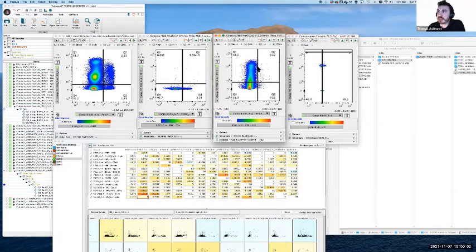It tells us that we're actually not creating a population that doesn't exist. We're not doing something inappropriate. This FMO control here is what tells us that that's actually the case. Now, in the next example we'll come to, you'll see that this seems a bit trivial. You might look at this and say, okay, correcting this one seemed pretty straightforward, I don't see what the big deal is. In the next example, you'll see why this is really important, because otherwise we might create a population which doesn't exist, which then influences our analysis.